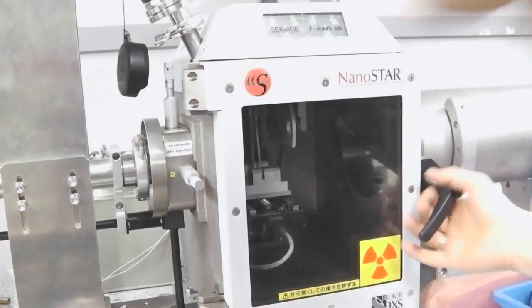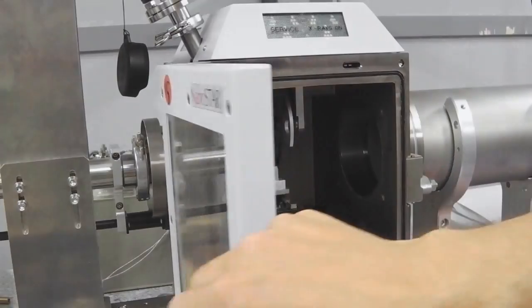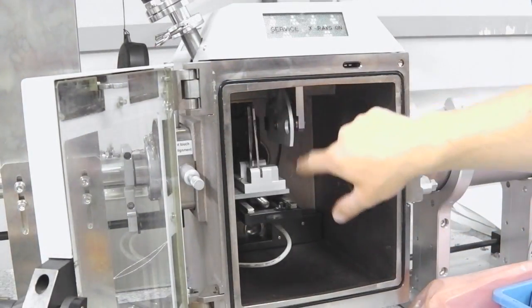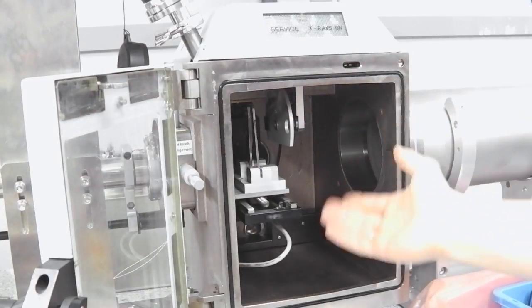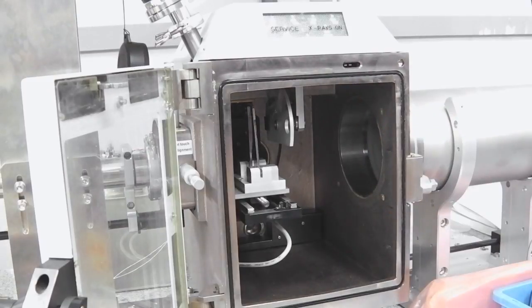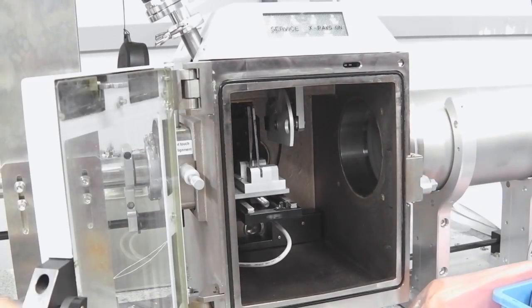Let me open this chamber for a moment. So here we have the sample chamber. Inside the sample chamber, we can mount our sample, and with the large translation stage, we can move it backwards and forwards and up and down. It's just a glorified vacuum box, really.